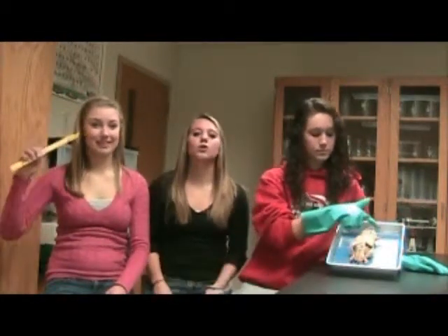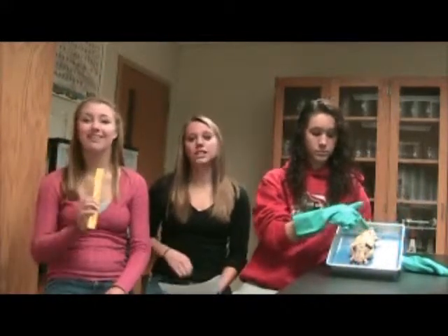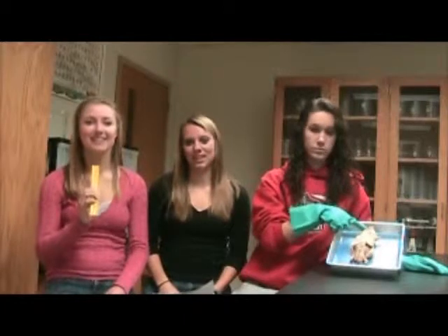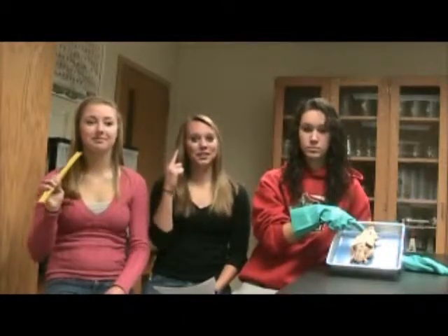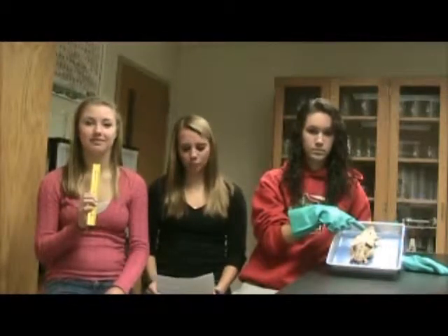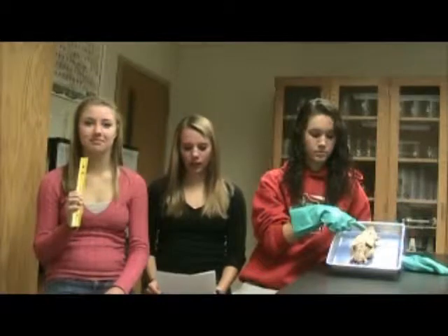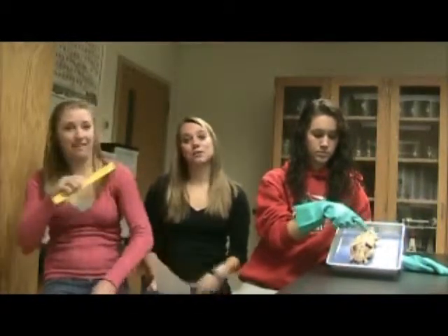First, let's start with the cranial region, also known as the head. Then we'll move on down to the neck area, which is considered the cervical region. This region connects the cranial region to the rest of the body. Now, speaking of attachments, we'll move right along to the pectoral region, which is where the front legs attach to the rest of the body.